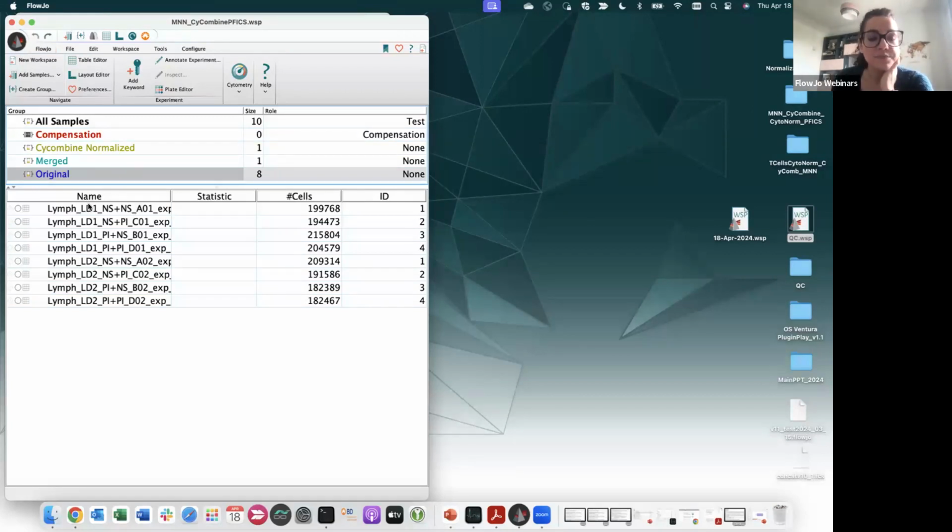I can create a concatenated file. So what I would do, I would select all the samples, clean up first in this case. Okay, so you don't want to use also your debris to normalize. So the more you clean up, the better it is. And as you see, I have only the lymphocytes here that I'm concatenating.